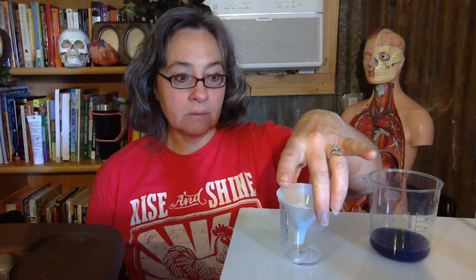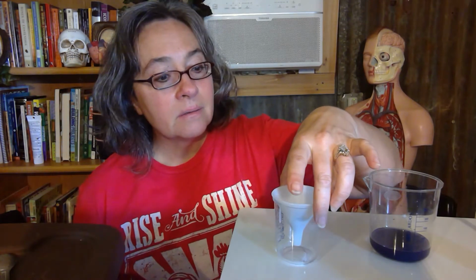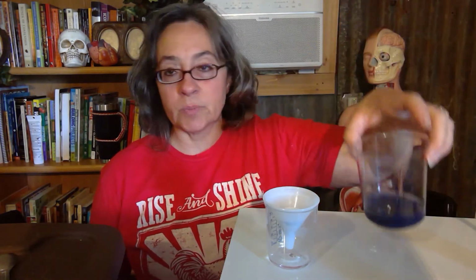So beaker 1, observation of contents after filtration. This is the filtration process. So the contents of this beaker is a clear liquid. Okay, it looks like there's purple in there, but it's the shadow, the dark where it's touching that whiteboard. It's clear liquid. You can see how clear it is. So it's a clear liquid that's coming through in beaker 1. Beaker 2, just go ahead and put dark purple liquid.